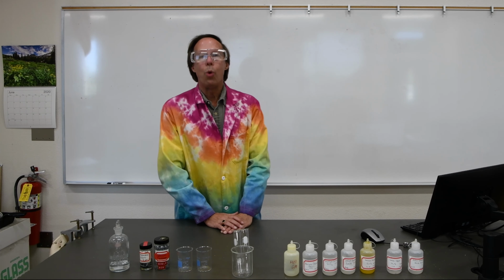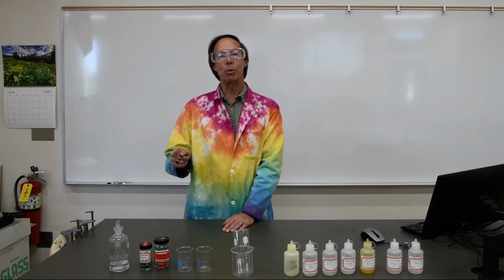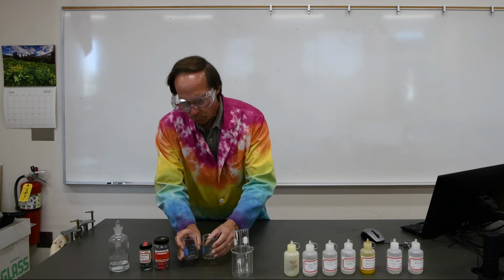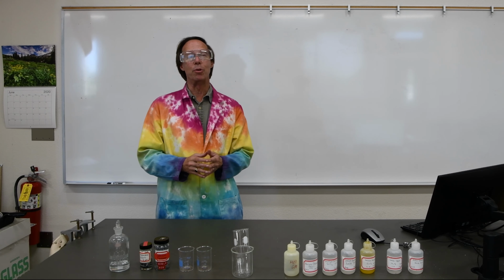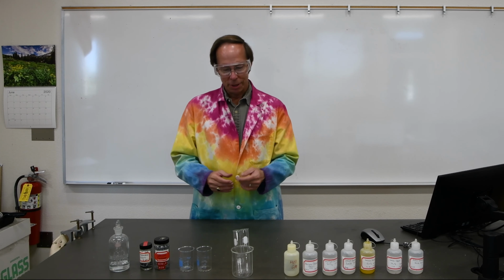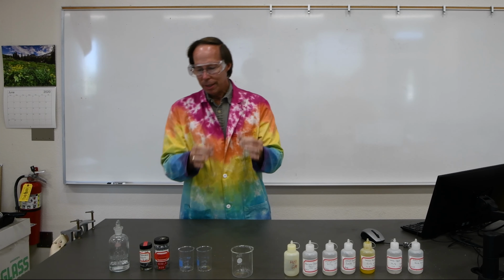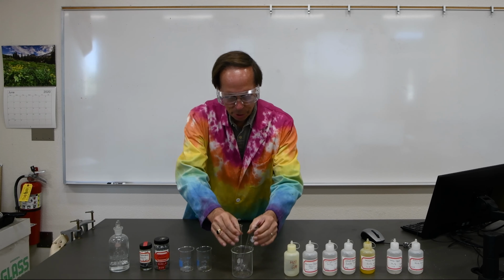Now the other goal of part A is to determine which metal is more reactive, magnesium or calcium, and as you're going to find out, when you use hydrochloric acid, it's going to be difficult to tell the difference. Hydrochloric acid is a pretty powerful chemical, and a lot of things react very vigorously with it. So we're going to do a second pair of experiments in part A, where we're going to take 2 test tubes, and we will fill them each about half full of deionized water, and then put a piece of calcium in one test tube and a piece of magnesium in the other.